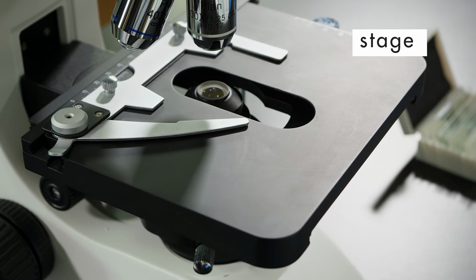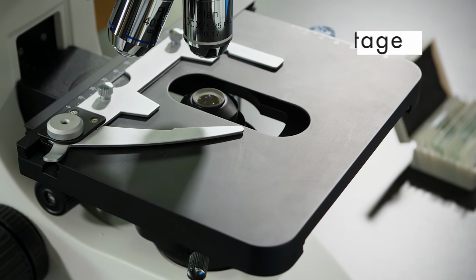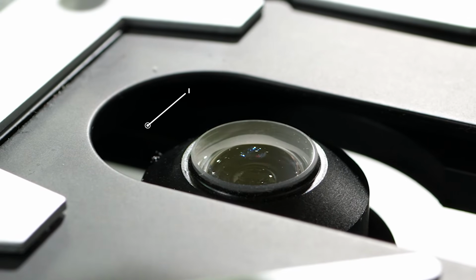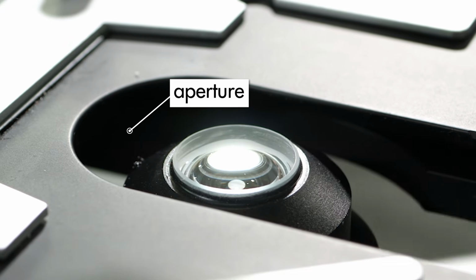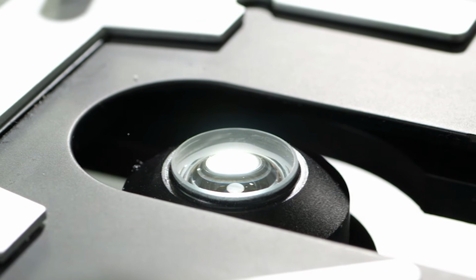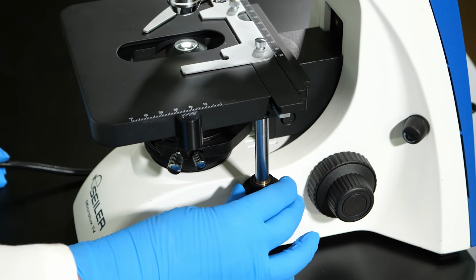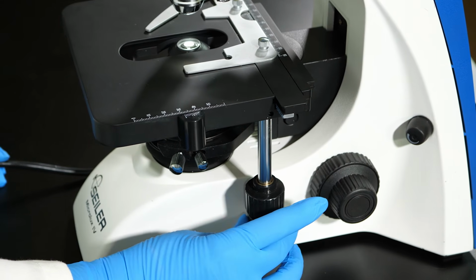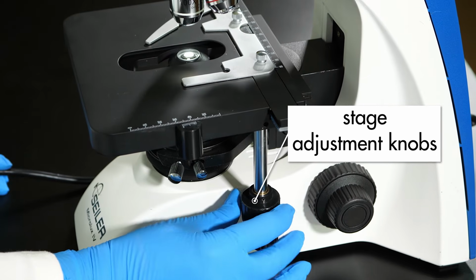The stage of the microscope is the flat surface that holds the specimen to be viewed. The stage has a hole in the center called an aperture. The aperture allows light to reach the objective lens. Our microscope has a mechanical stage that allows the viewer to move the specimen forward, backward, and from side to side with 2 stage adjustment knobs.